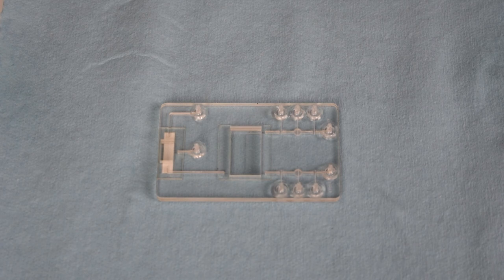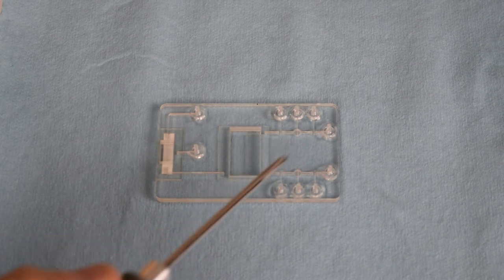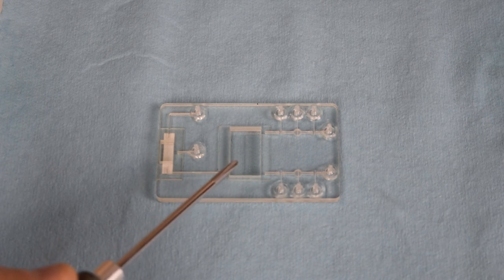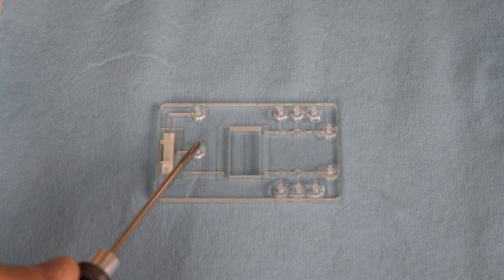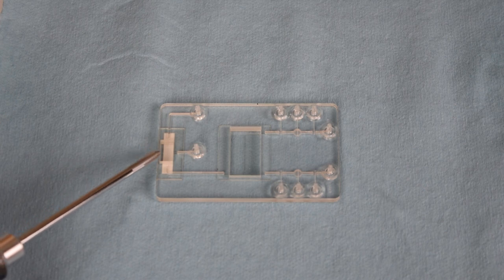So we commissioned a microfluidic chip to reproduce typical conditions seen within a microfluidic cartridge or chip testing device. This chip is designed with 1 millimeter microchannels. It includes a T-junction channel, which replicates complex mixing that is known to create bubble occurrences. The chip has various nodes for pumping air. Air will be pumped in here. The fluid will be pumped in here. Pulling a vacuum, this will be the receptor, or where the fluid comes out. And of course, the bubble trap or debubbling device made with Porex Virtek PTFE.